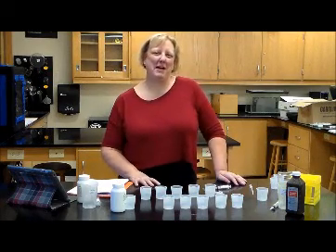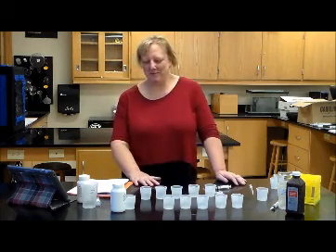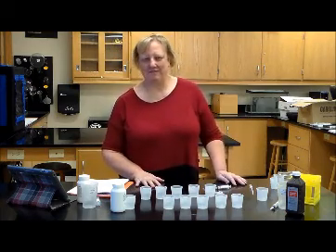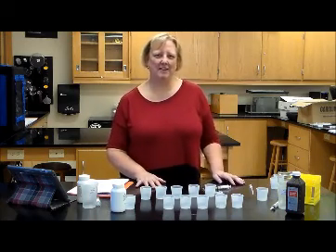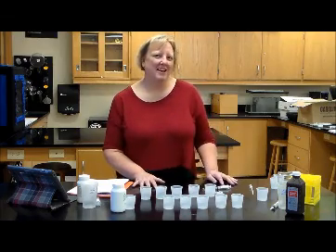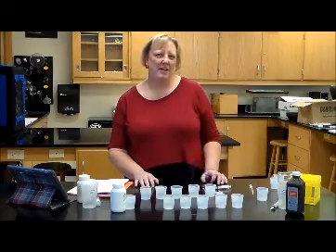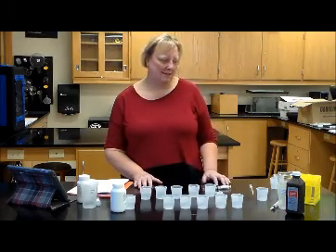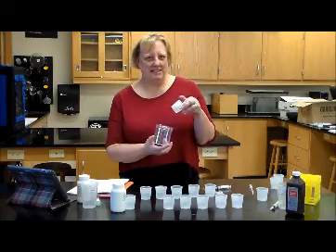This is the AP Biology Enzyme Catalysis Lab. Today you're going to be working on a lab that involves the enzyme catalase and determining what kind of reactions it has under several different conditions. You'll be using several different kinds of materials for this lab, and I want to go ahead and point those out to you first. You'll be using the enzyme catalase.